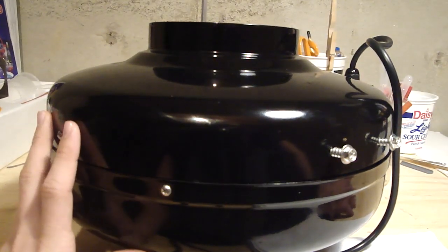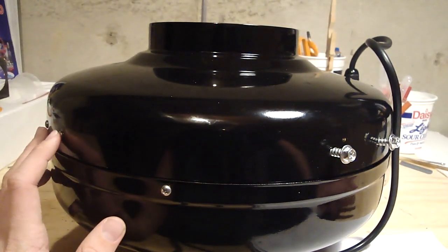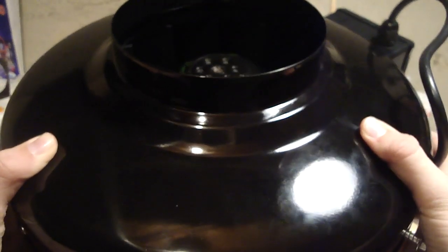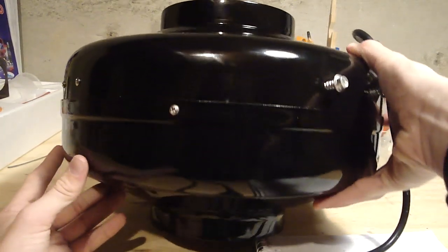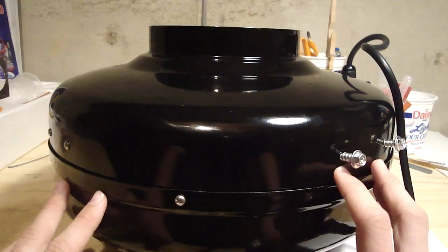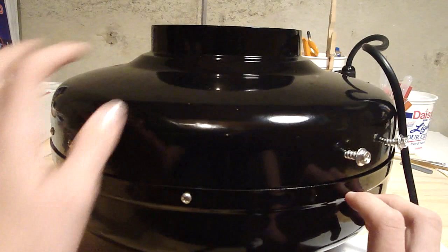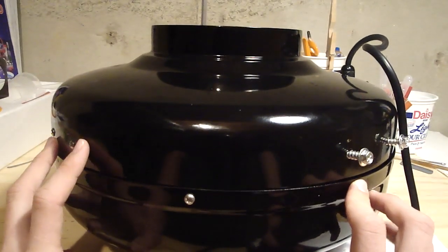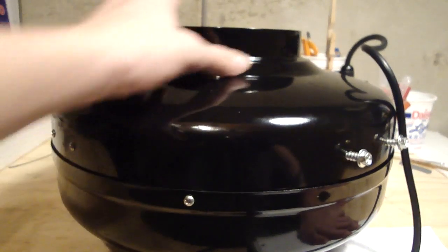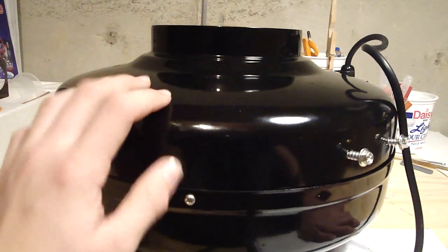Those are all the parts you're going to need for the fume hood. This design doesn't have a bottom, so I can move it around and set it on any table I want, making it more portable. This is a six-inch fan — six inches diameter at the opening. You want to get an inline fan so you can hook it straight into a duct. The brand is CAP inline centrifugal fan, really nice quality. For ducting we're going to use a six-inch dryer hose, clamped onto the fan so we can remove it if needed.